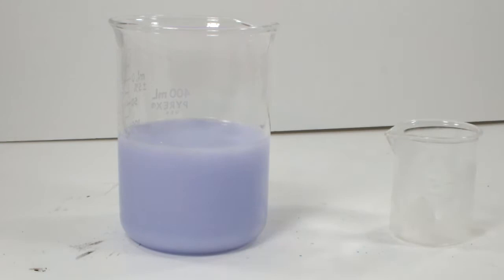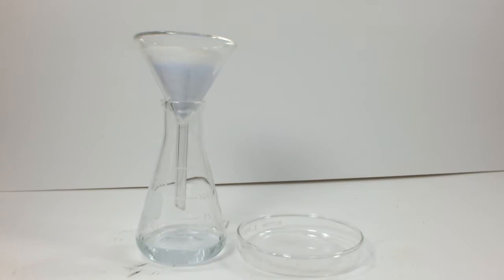Once I get the bigger beaker, I go for broke and add tons of acetone. After a little settling time, it should come as no surprise that there is no further formation of precipitate on addition of more acetone. So this is going to go back in the fridge now too.